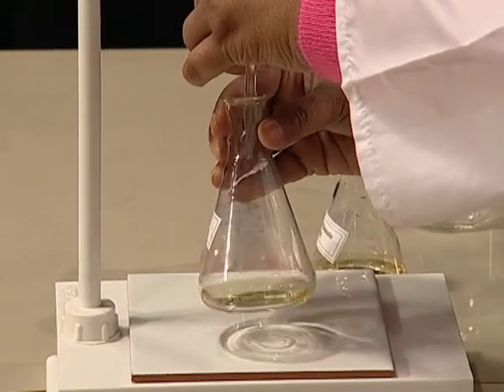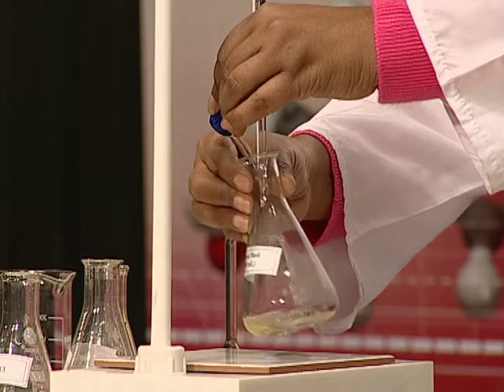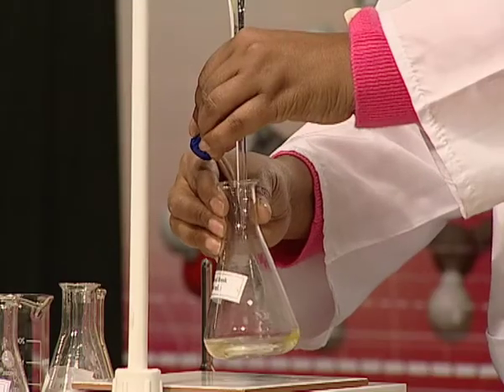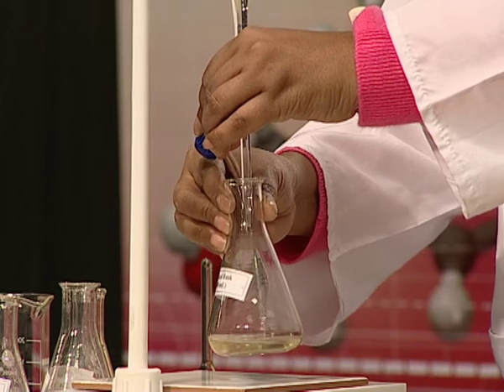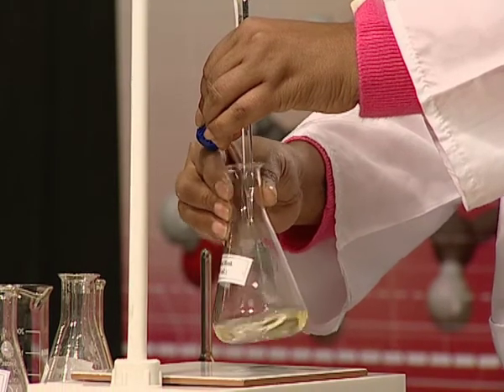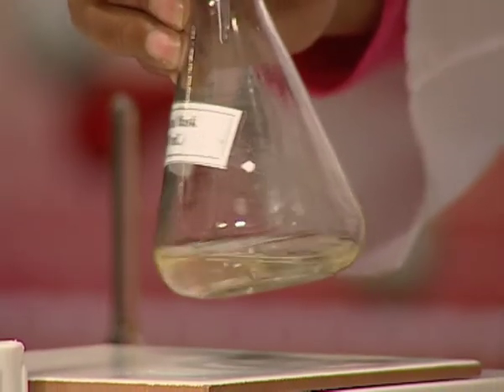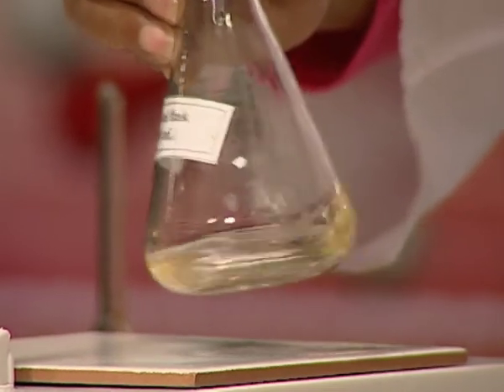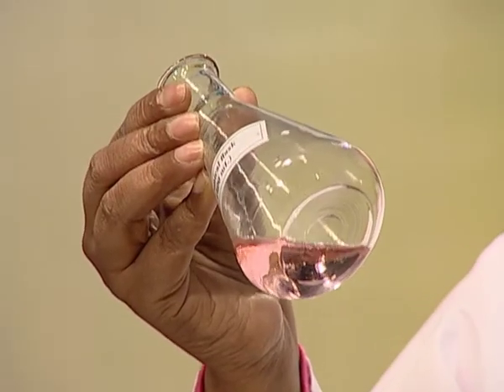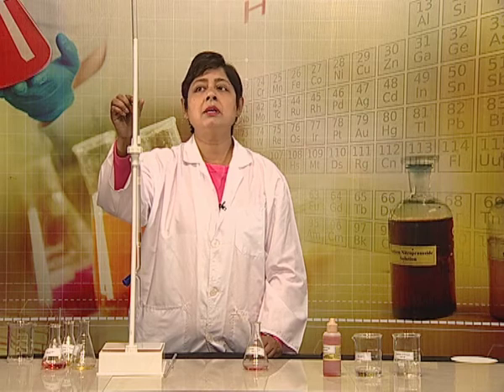Now we slowly add the hydrochloric acid solution from the burette to the conical flask. Observe carefully. When we add the hydrochloric acid to the solution, the color changes to reddish pink. But as we mix the solution thoroughly, the color changes back to yellow. Please continue to titrate, checking the color of the solution. The final color at the end point is pinkish red. Note the reading on the burette — it is called the final reading.